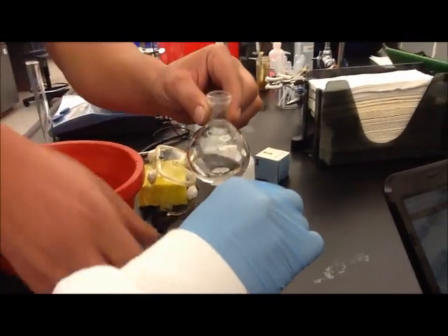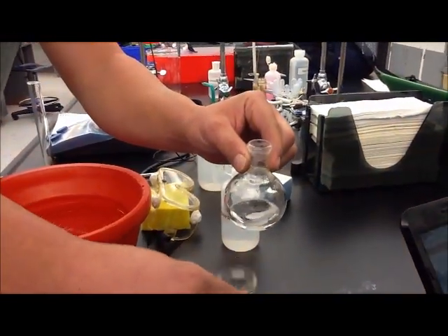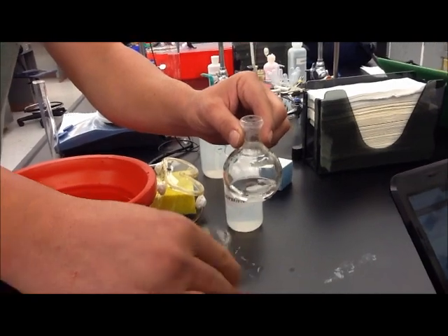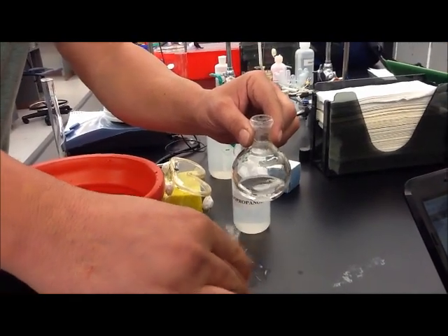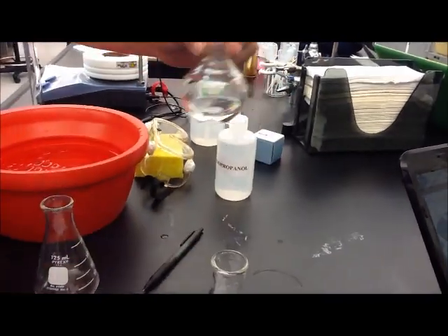We're adding 95% ethanol to our phenacetin. I don't want to overdo it because then we won't get as much product. We need to add just as much as needed.